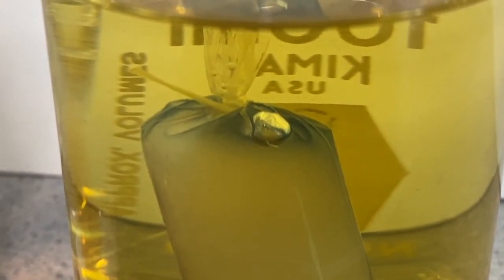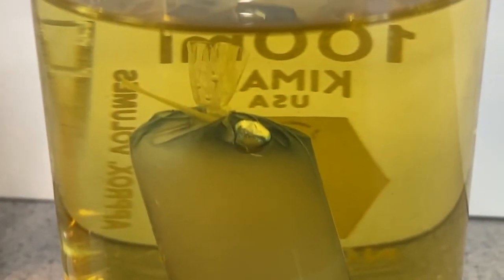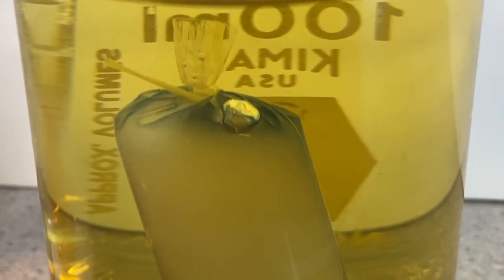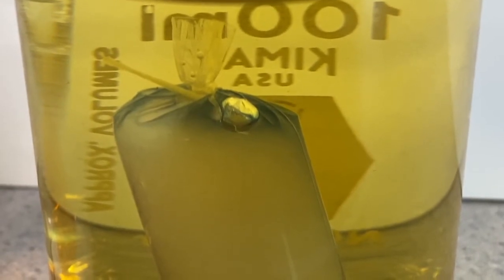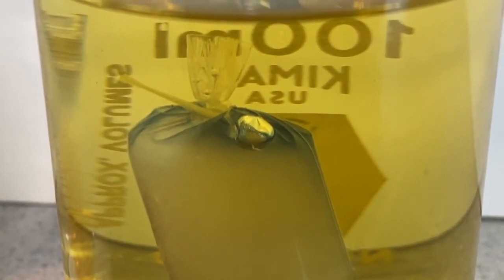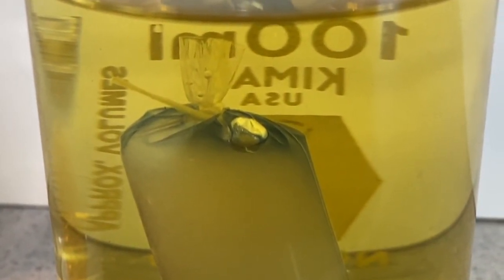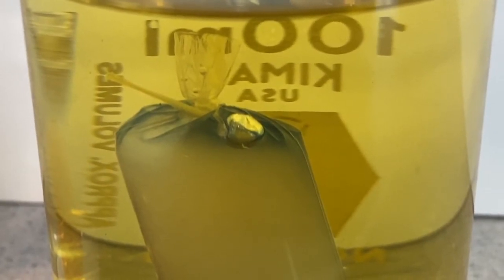However, we do see that there's some of that bluish purple color on the inside of our cell, which you might recall was not there before. And again, if we think about what that color is supposed to indicate to us, we should be able to draw some conclusions about what exactly is happening here. And if diffusion is occurring, we can say something about what is diffusing and in what direction, based on where we see that blue.